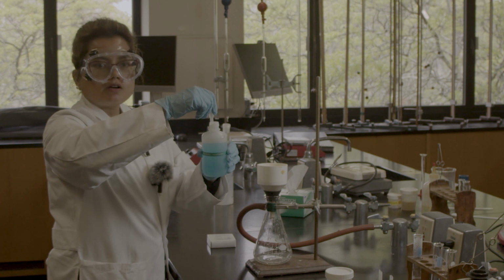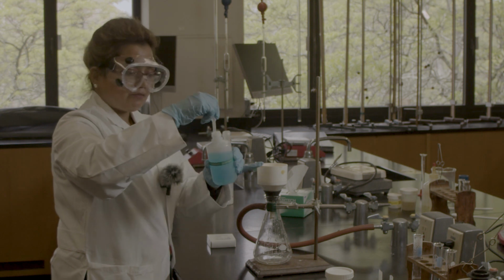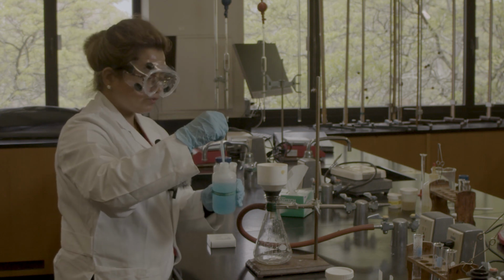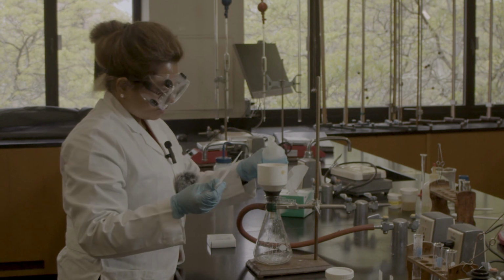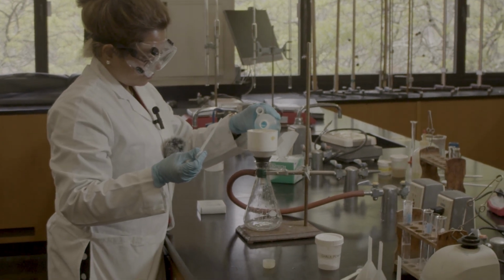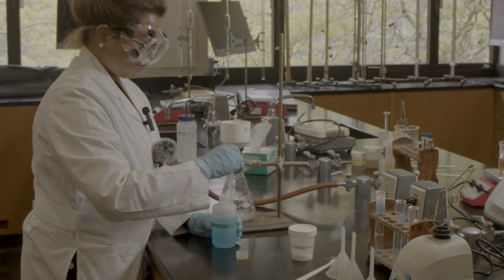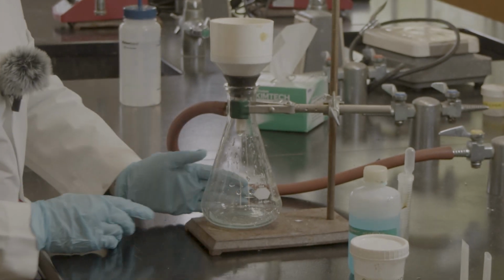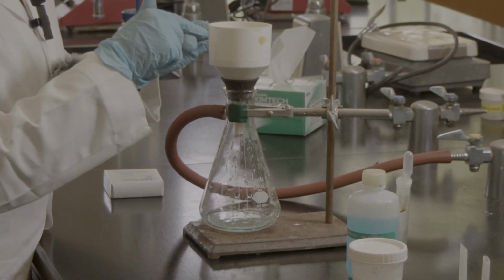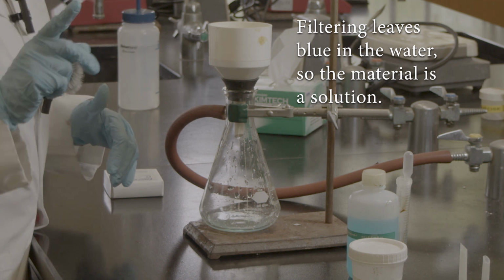Because there is no layer. If it has a layer, we can filter it out. If it doesn't have any layer, if it is soluble, we cannot filter it. So as you can see, this is blue color. My water is getting blue, so I cannot filter it out using my filtration technique. If it is homogeneous, with no layer, we cannot do the filtration.